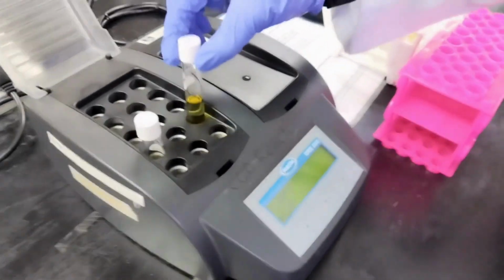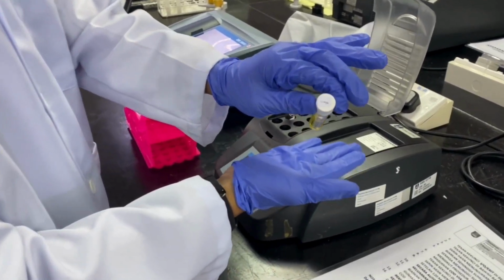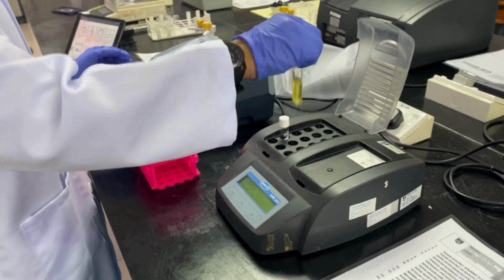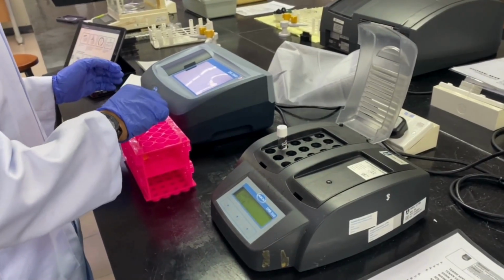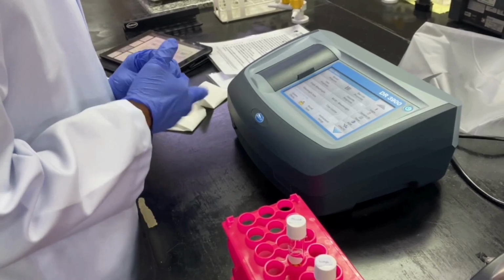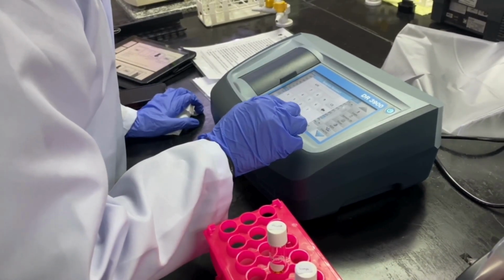After 2 hours, set the power off and let the vials cool until the temperature decreases to 120 Celsius. Invert each vial several times while it is still warm. Put the vials in a tube rack to cool to room temperature. Power on and select the 430 COD-LR program.